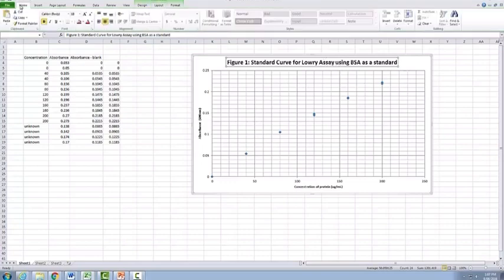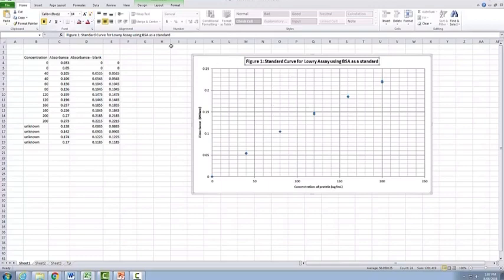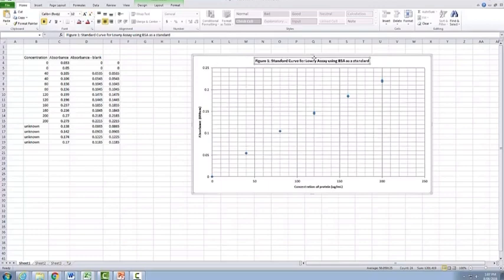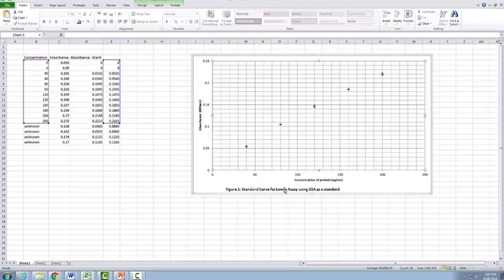So what I will always do is go here to home and I will shrink the size of our font here, maybe a little bit smaller again, and then you can actually, if you get the cursor to have the 4-way arrows here, you can actually pick up your title and move it down to the bottom. You can then do the same thing for your graph. You can actually highlight your graph and then move the entire graph up, which now means that you can move your title to wherever you'd like to have it, whether you wanted to have it centered or whether you want to have it over onto the side here. You can also obviously change it to not be bolded as well. It's up to you as to how you would like to have that title actually completed.